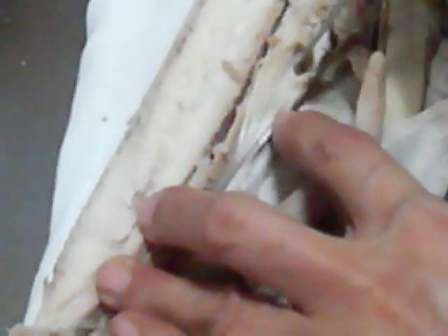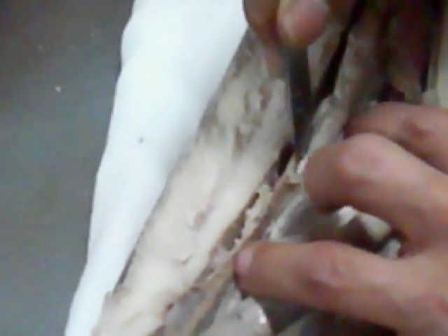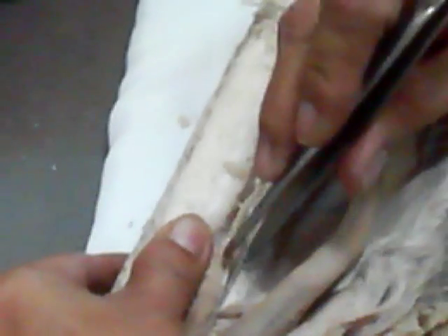Try to look for the seminal vesicle. This is now the seminal vesicle, which is very big. Try to separate the seminal vesicle from the opisthonephros.